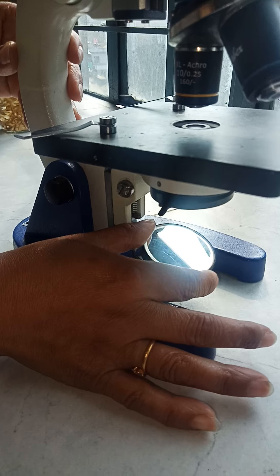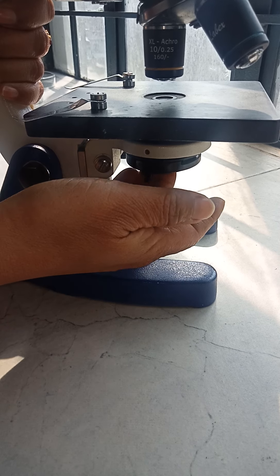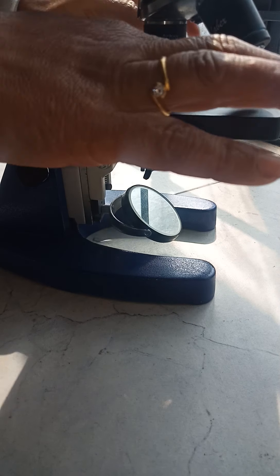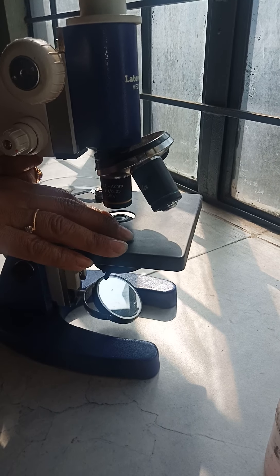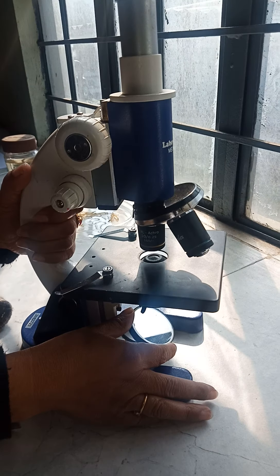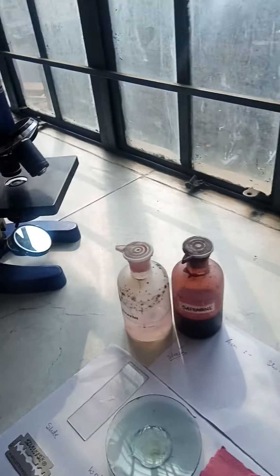Below the lenses, you have this mirror. This microscope works on light — light falls on the mirror and is reflected up through the condenser, allowing you to see what you place on the platform through the eyepiece. If you do not focus the mirror toward a light source, you will see nothing — it will be black. This compound microscope works on the principle of natural light, which can be sunlight or artificial light.